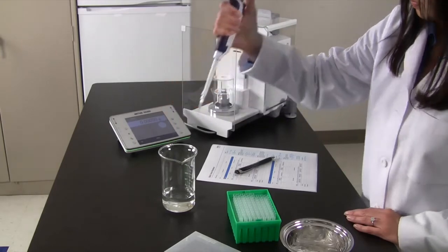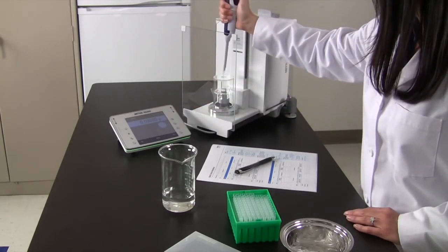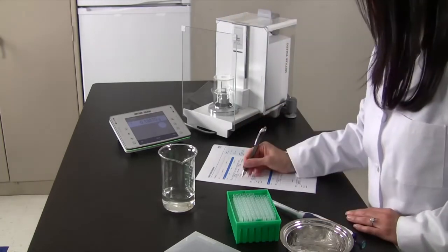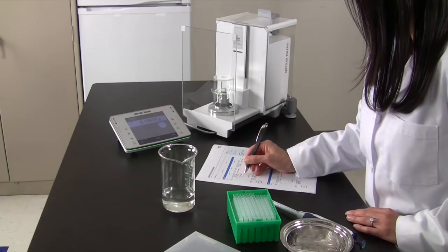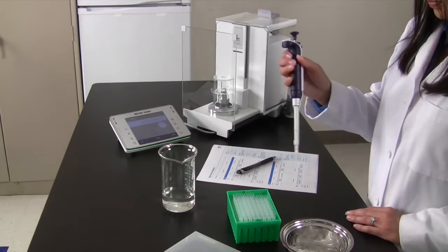Now, using the same tip, repeat the process three more times, recording the mass each time. Eject the tip after the final dispense.